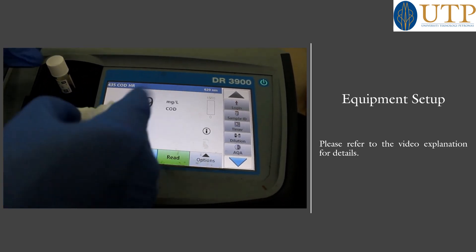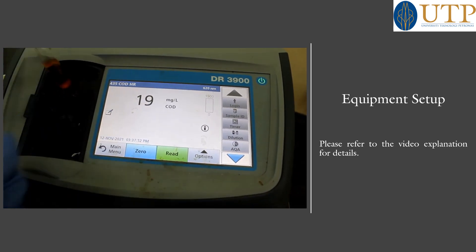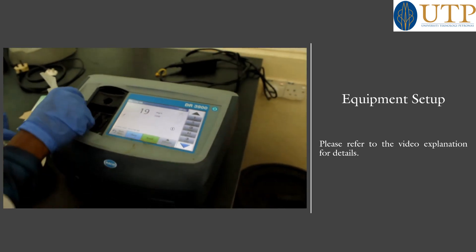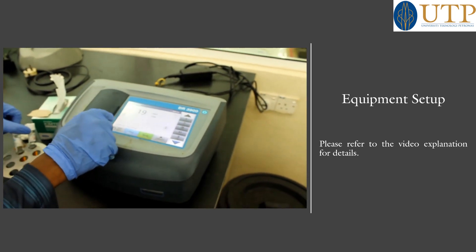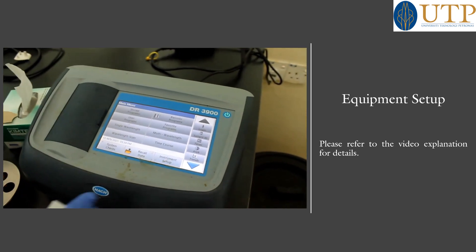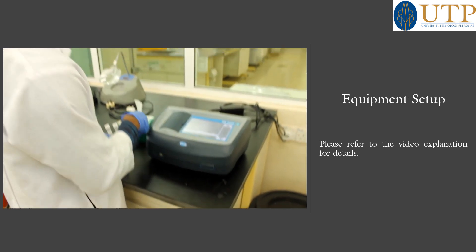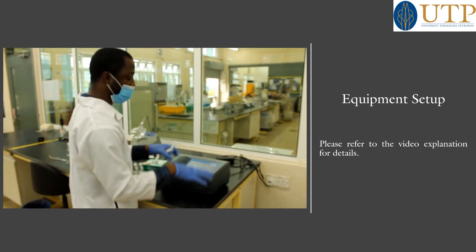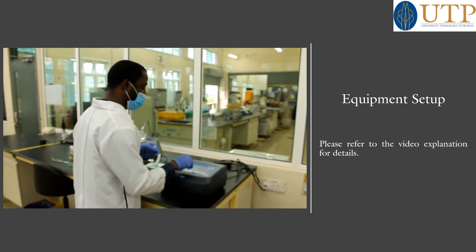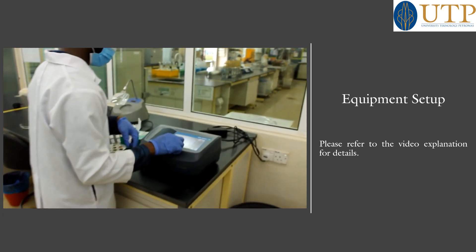After that, take your reading — you can snap it or note it down. Results are understood. Take out the vial and close the lid. Go back to Menu. We are now done with the COD testing using the spectrophotometer. This equipment is used for a lot of contaminants, so you check the stored programs or go into user programs — whichever one you need to get your values.